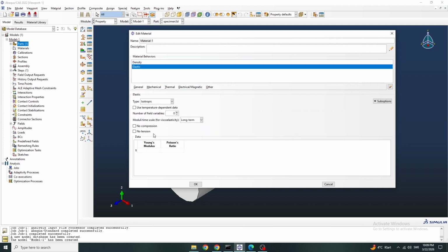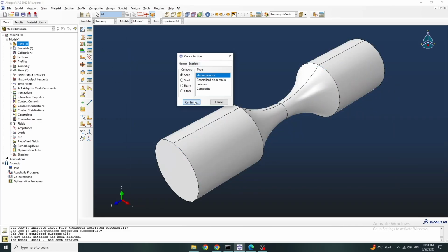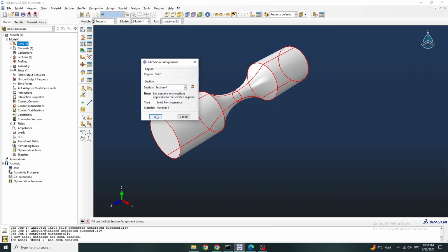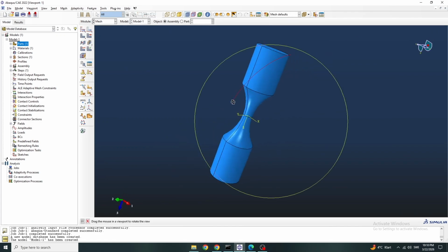Elastic properties: Young's modulus should be in megapascal, and then the Poisson ratio. Create the section, and now we assign the section. Assemble the part and mesh it first, then we create a step.